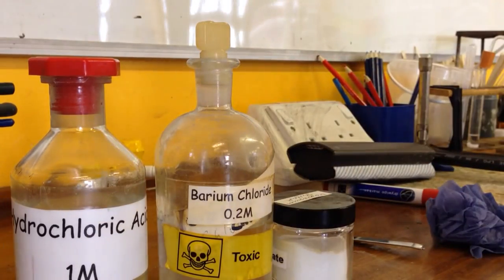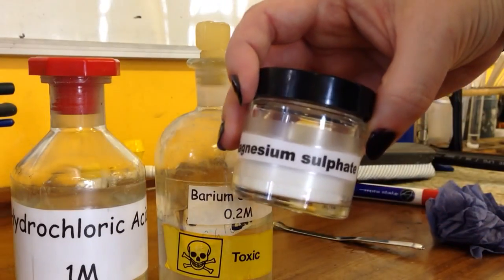I've got some hydrochloric acid, 1 molar, 0.2 molar barium chloride, and I've got some magnesium sulphate.